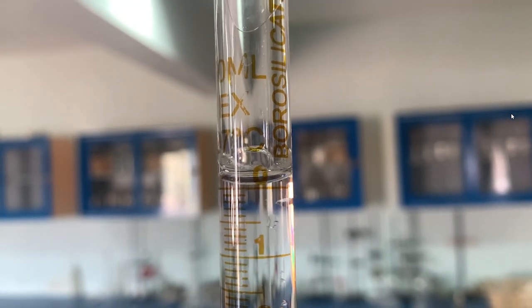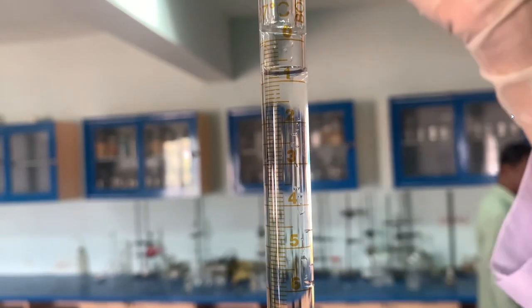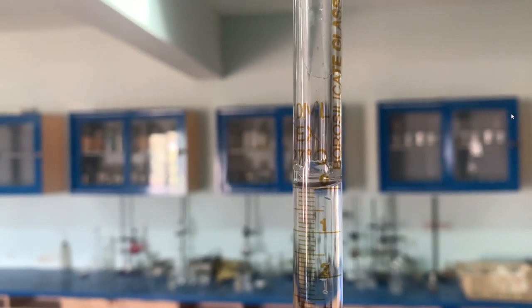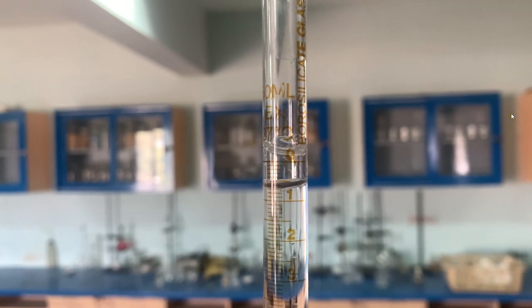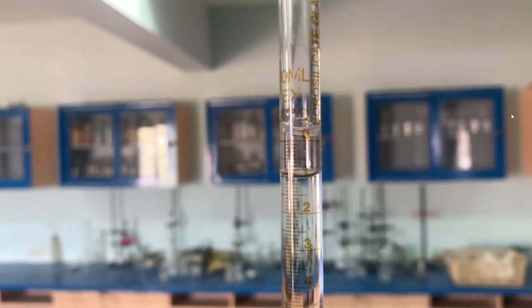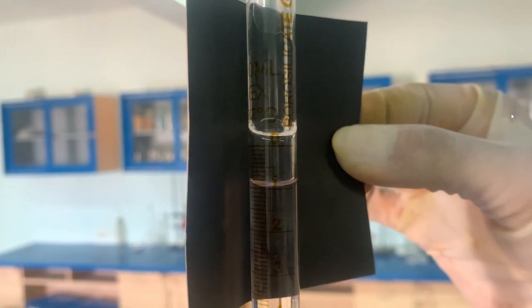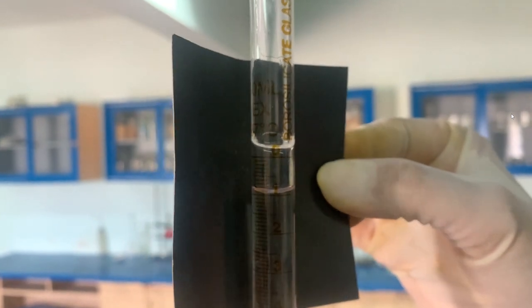So now we will check the initial reading. The initial reading can be checked by recording the lower meniscus. This is our initial reading. We use phenolphthalein. We have to record the volume after having a look at the lower meniscus. The lower meniscus will be read and we will record the volume of the initial reading.